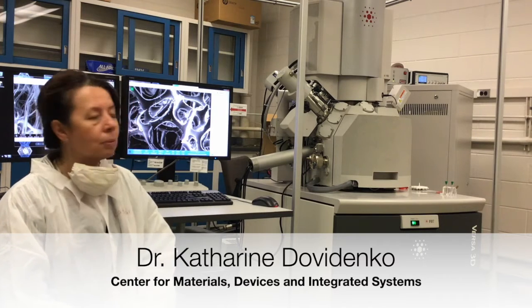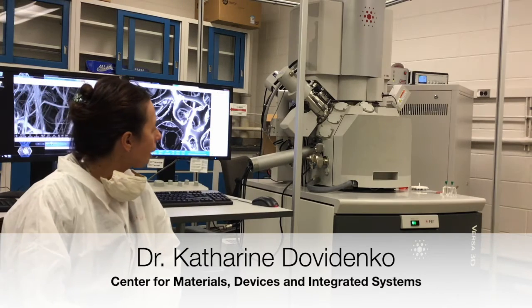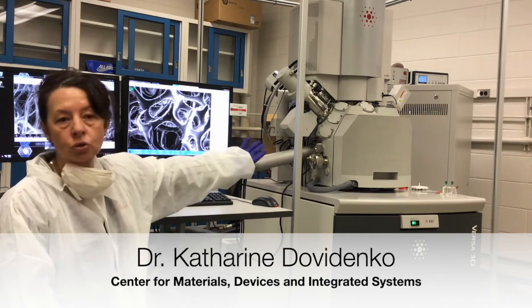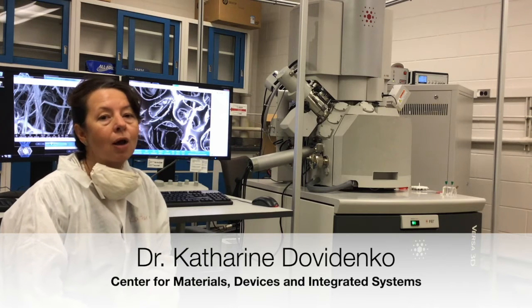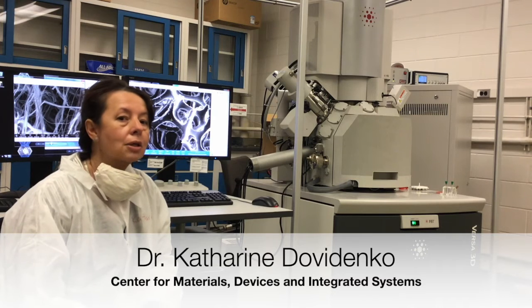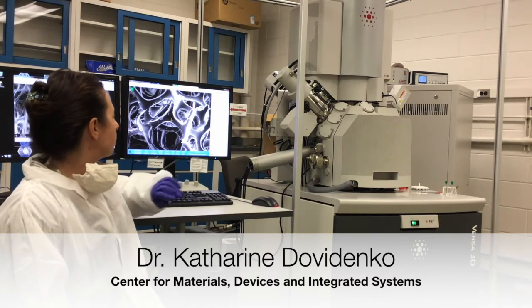So here we can put our material or device of interest inside of the scanning electron microscope focused ion beam chamber, which is this big front door that you can see in the front of the instrument. We do the analysis while our material or device is under vacuum. And once the material is analyzed, we can take it back out. The analysis is done and recorded through the computers here.